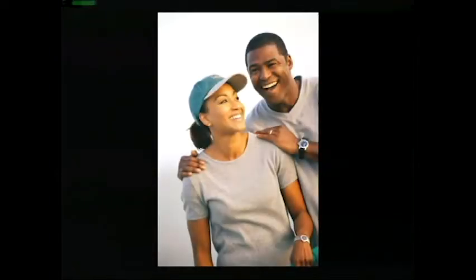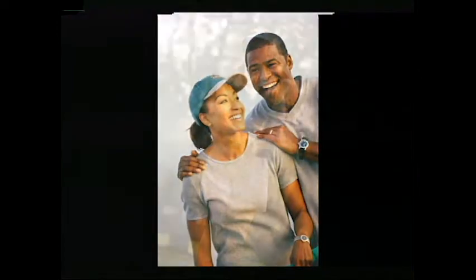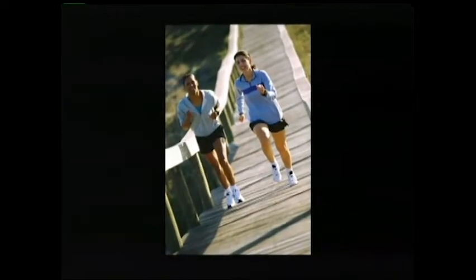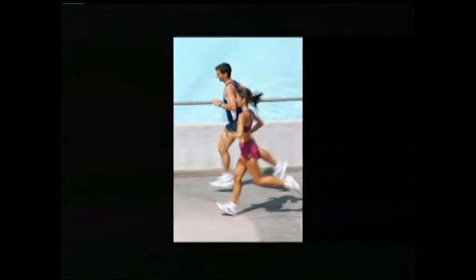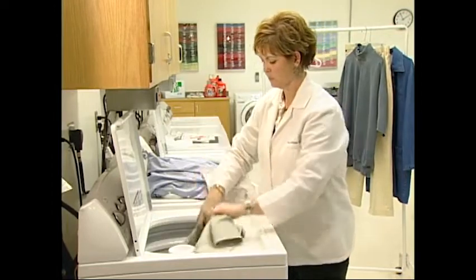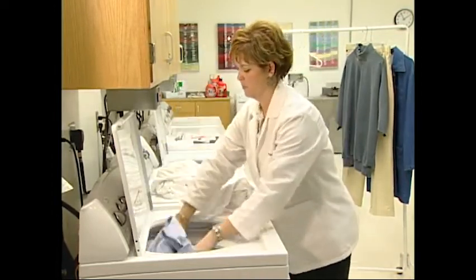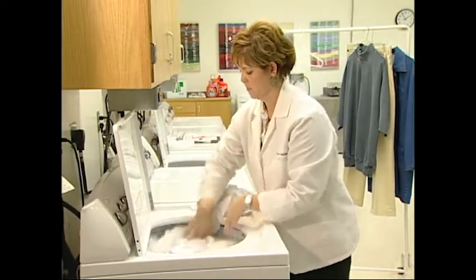Fabrics are normally tested for manufacturing purposes and for textile home products. Garments are tested to determine their wash and wear properties as well as their potential fit. Dimensional stability for garments is covered in AATCC Test Method 150, Dimensional Changes of Garments After Home Laundering, and is designed for accurate analysis of the dimensional stability of garments.